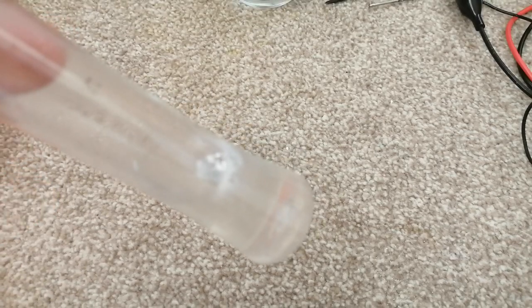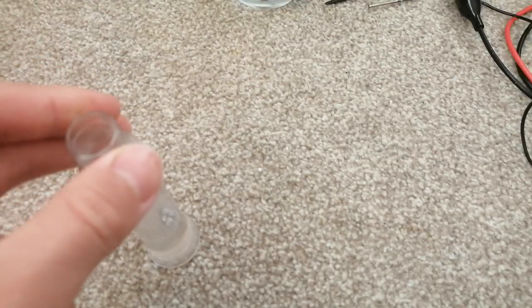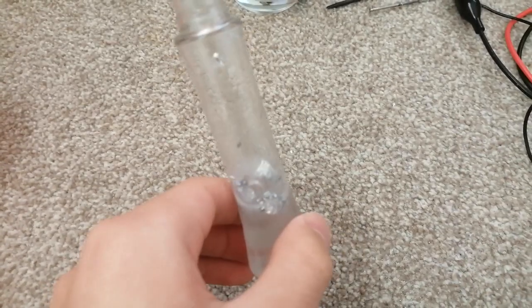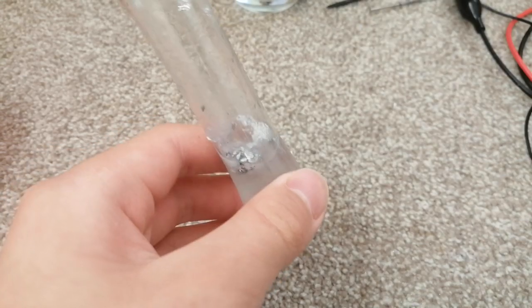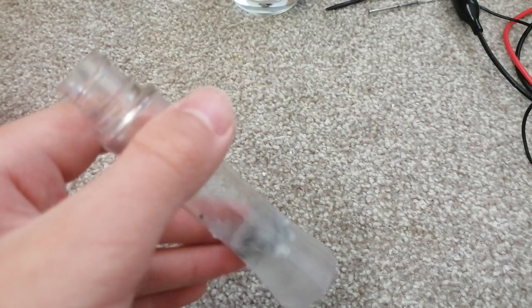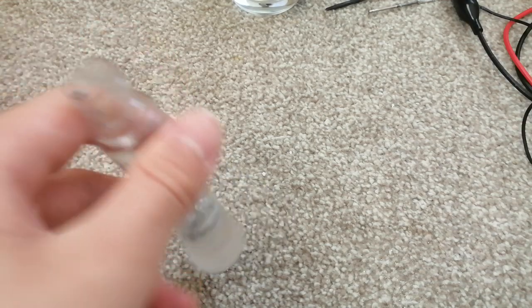What's left in the solution should be sodium aluminate, which is another compound that is also quite caustic, but less caustic than sodium hydroxide itself. More pieces dissolved in produces even more hydrogen — you can actually collect it by adding a balloon on top, but I don't have a balloon. When it dissolves, it does release quite a lot of heat, which you can feel warming your hand. It's a very exothermic reaction.